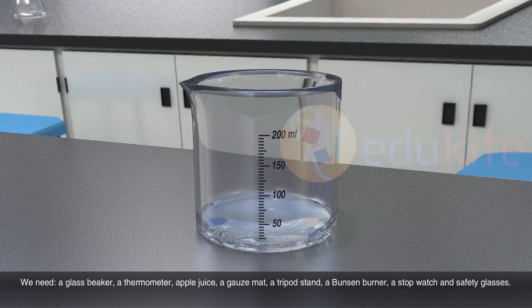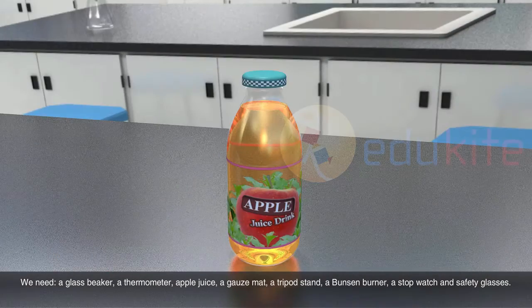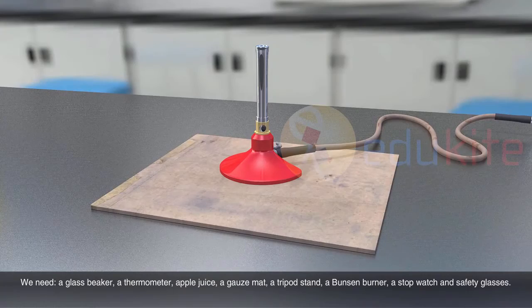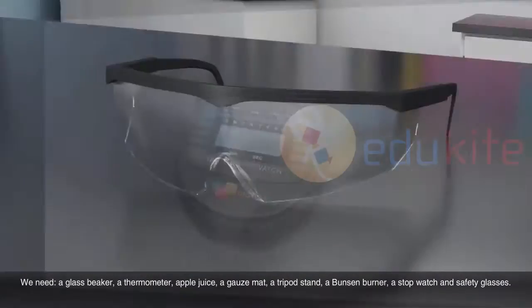We need a glass beaker, a thermometer, apple juice, a gauze mat, a tripod stand, a Bunsen burner, a stopwatch and safety glasses.